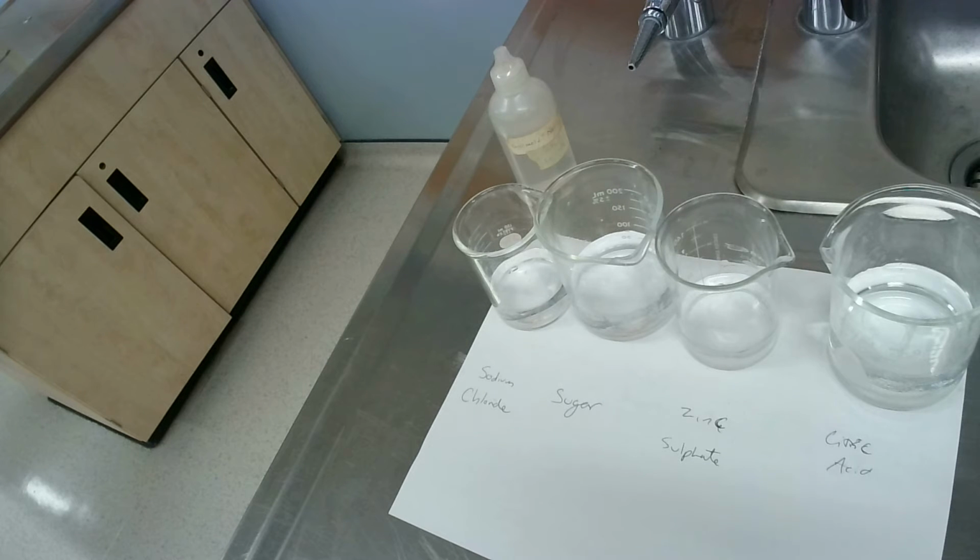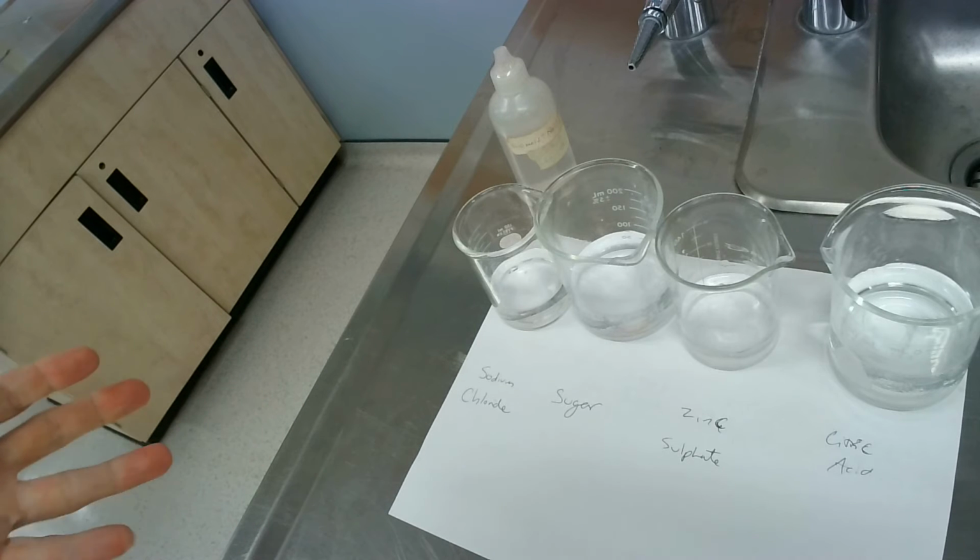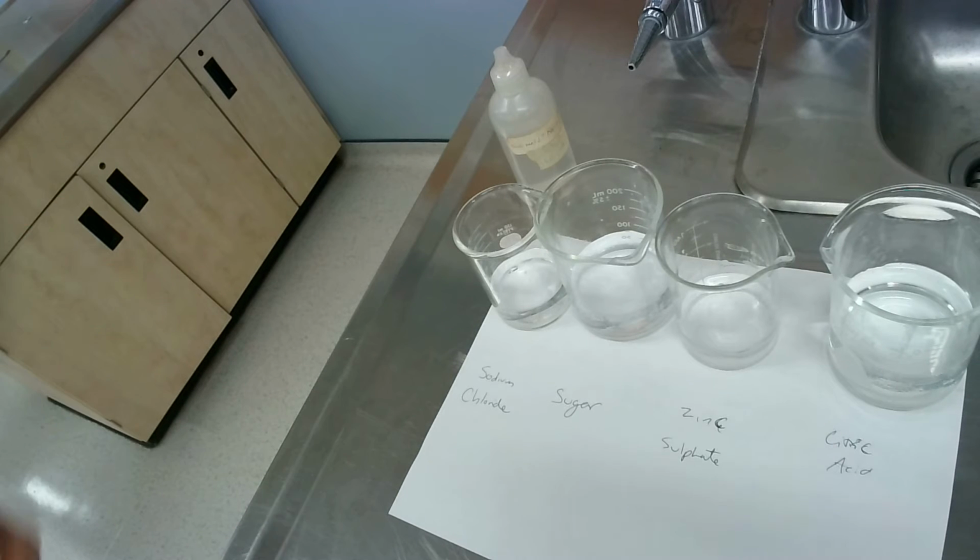Right, so now we are looking at, I want to say part C, but it's not on your lab like that. But we're looking at the conductivity when aqueous, okay? So aqueous means in like a liquid form, okay? So it's dissolved in the water. And conductivity is, we're just kind of looking at the degree to which a specified material conducts electricity, okay?